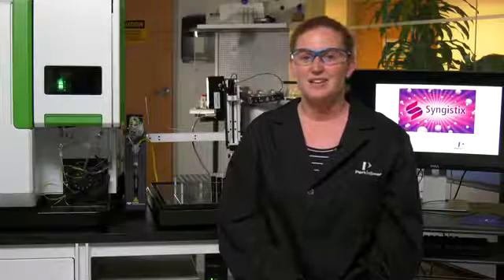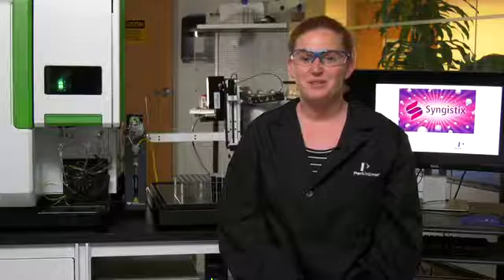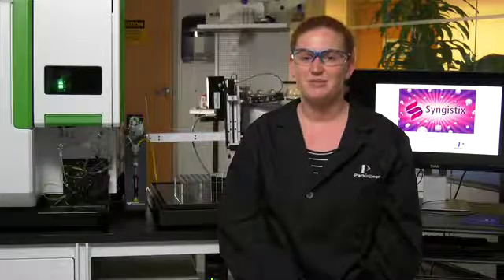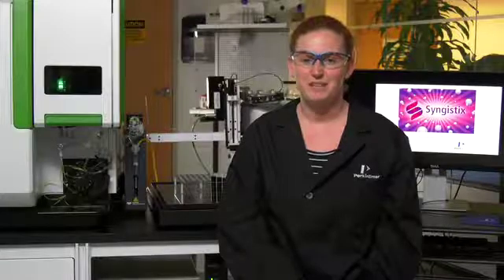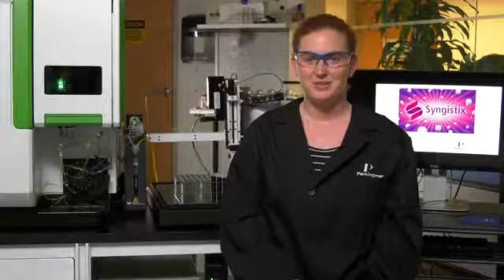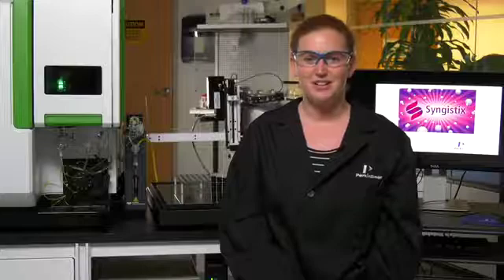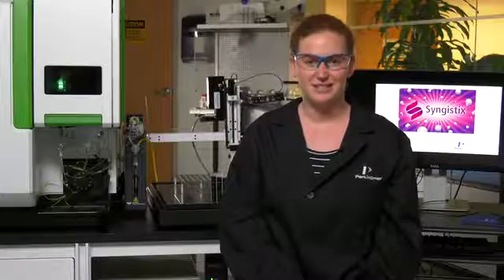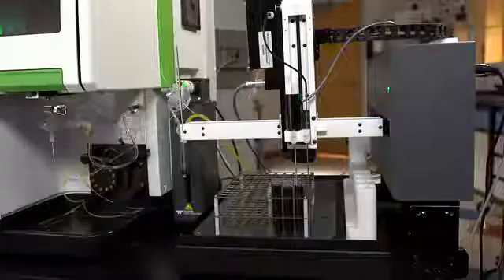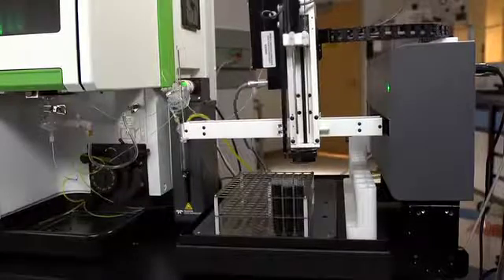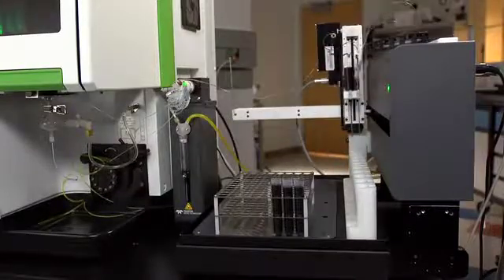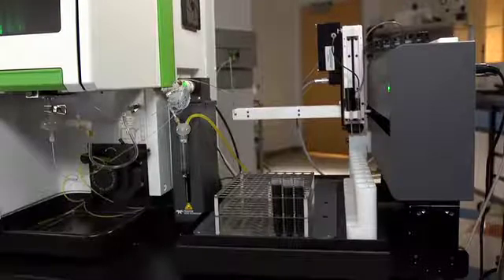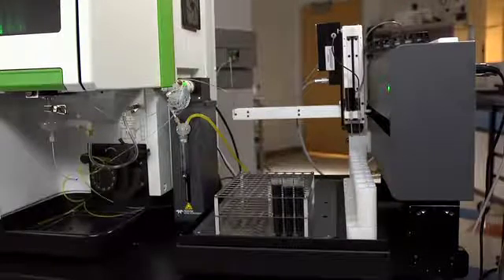It is important to have all samples using the same method grouped together in the rack and for the first sample to be placed in the row closest to the auto sampler body. This row of samples in standards positions are singled out for smart stir functionality, meaning the auto sampler will first stir, rinse the probe and stir paddle, then return to the sample with the probe to collect the sample for analysis.